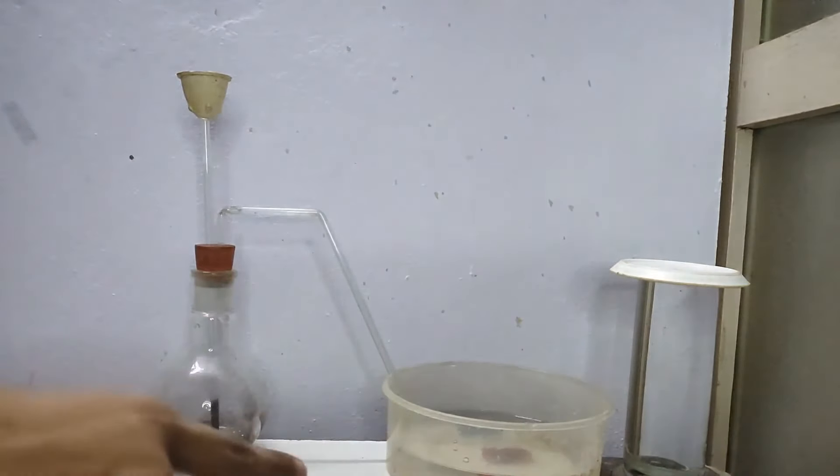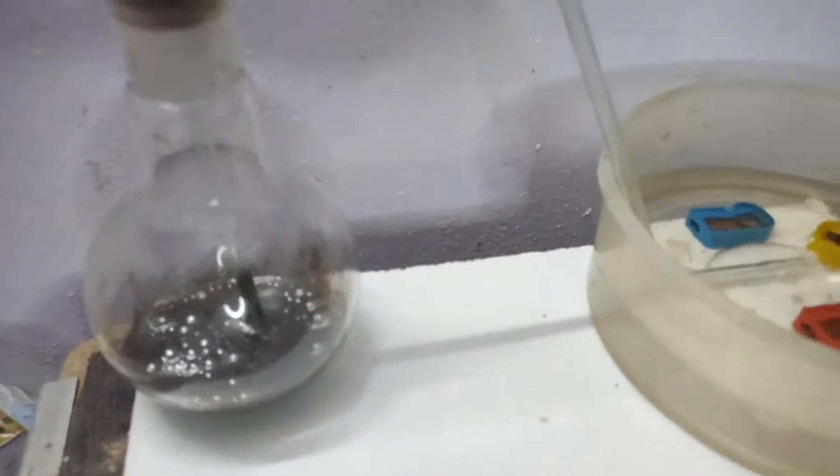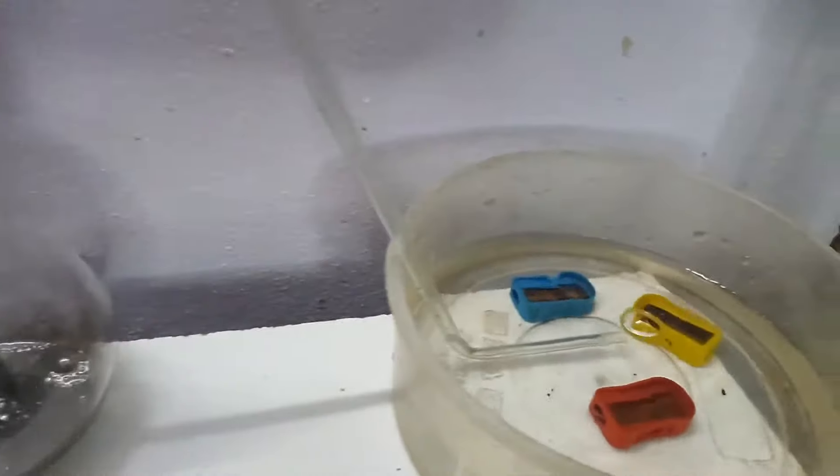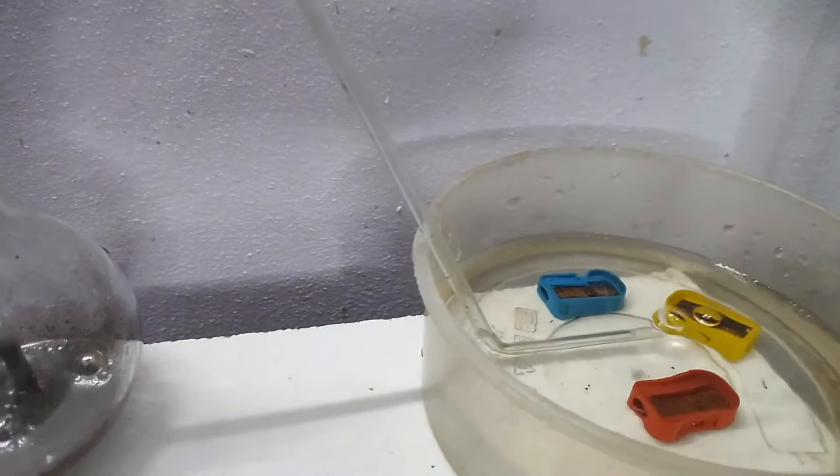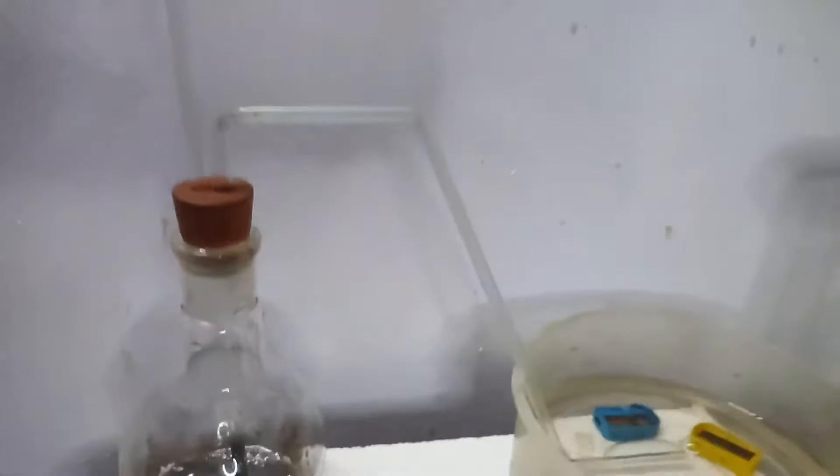You can see the bubbles inside the flat bottom flask. That means our reaction has started. And you can also see that some bubbles are coming out of the delivery tube.